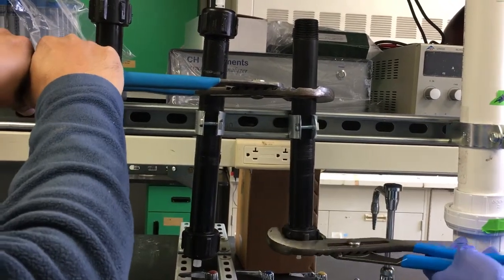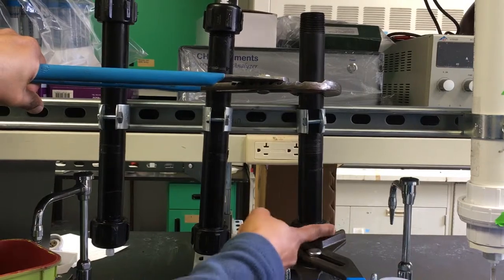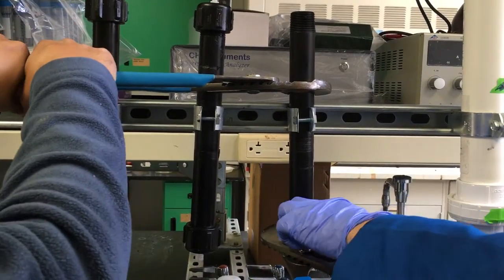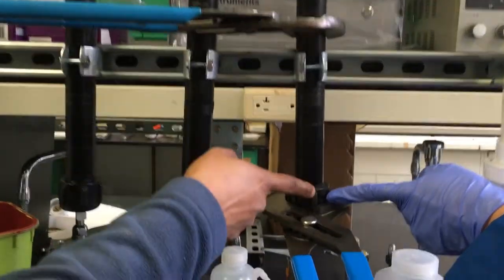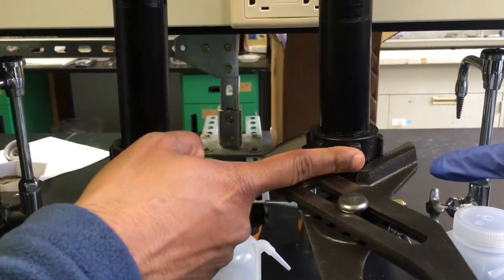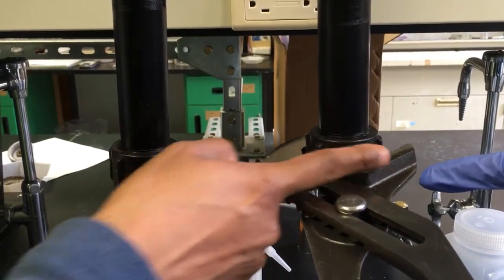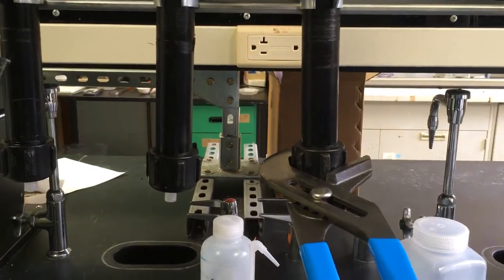And make sure that these teeth stay parallel. This hole has to be within the teeth, yeah, and the teeth should not touch the edges. It should go towards the inside, so this is parallel. You don't hold this one here, because this will otherwise erode away. Yeah, this erodes away if you hold it here. Like I am holding it, it's perfect.